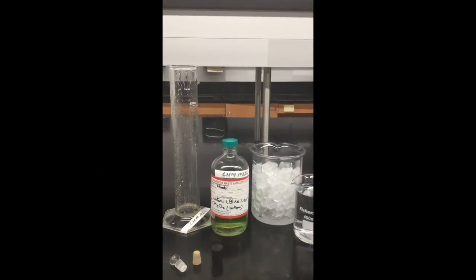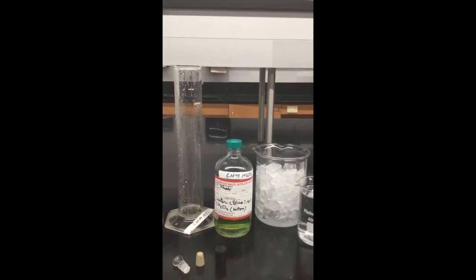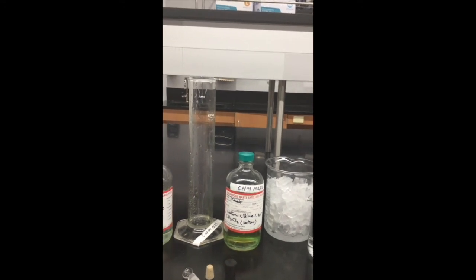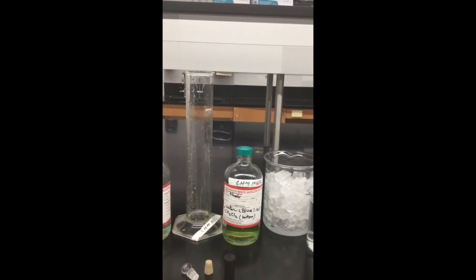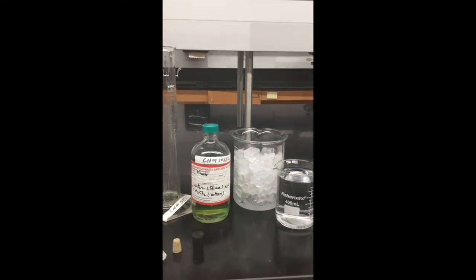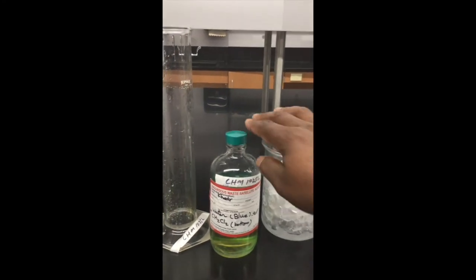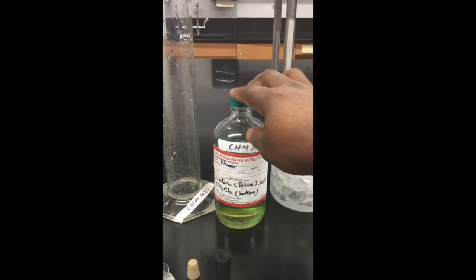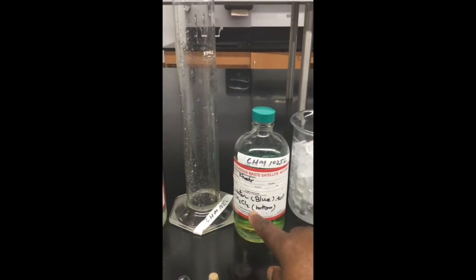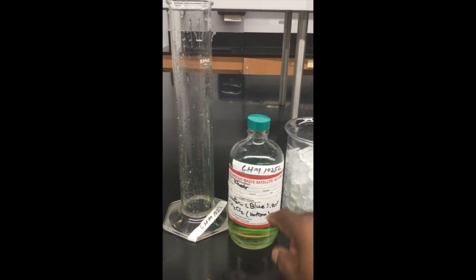Part A, you will identify substances based on where they will fall in the tall glass cylinder. What we have for part A is H2O, which is a blue substance in this container. There is the methylene chloride at the bottom right here. It's important that you take note of the substance we are working with.